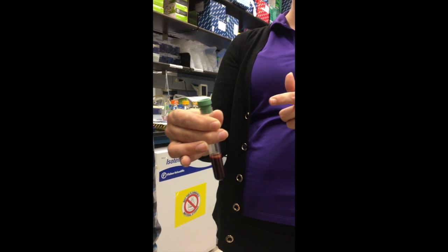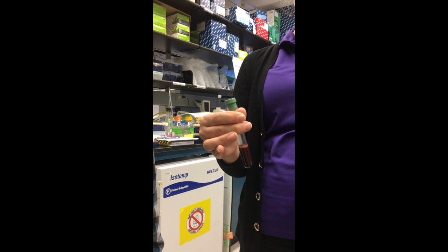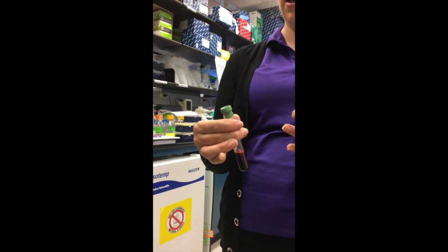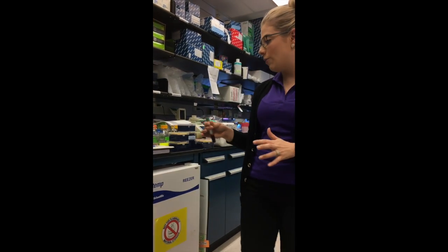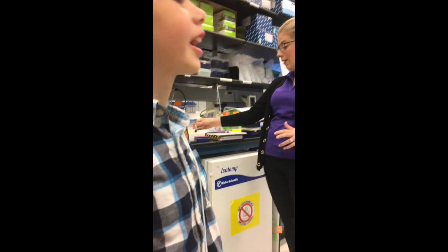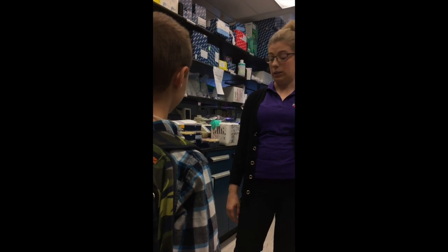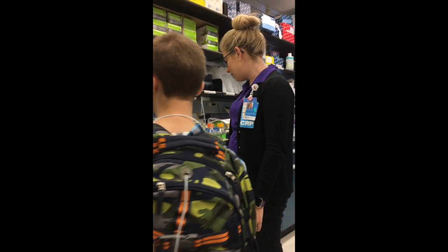We can also do saliva, so if we're really interested in your family and the genetics, we will call the family and send you spit kits, and we'll say, before you brush your teeth in the morning, I need you to spit for me. That would be another way of getting DNA without having to do a blood draw, because those hurt a lot. All right. So I think it's time for our experiment.